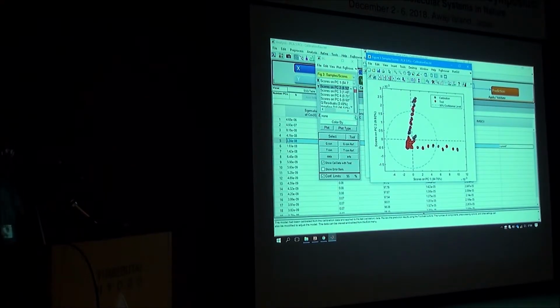There's a lot more you can do. You can use these functions that the software provides and use your own functions and combine the two in the MATLAB version. So if you have any other methods you want to apply, you can add them to these capabilities. Since most of you don't have this software, it's not interactive, that's why I just went through this fast.